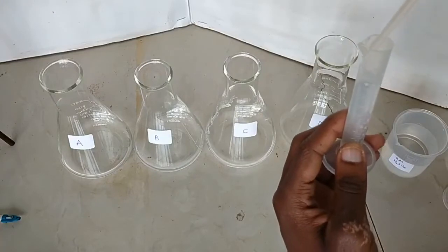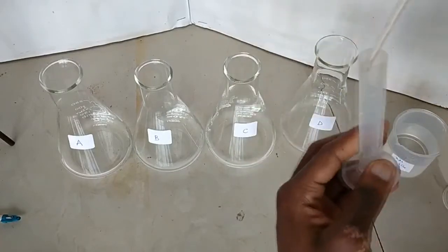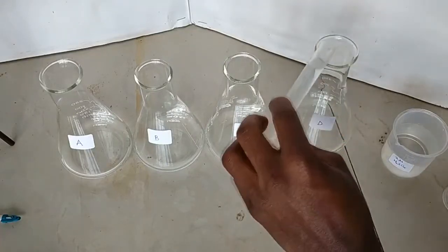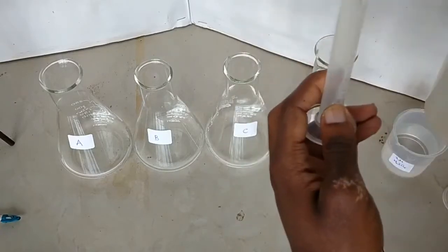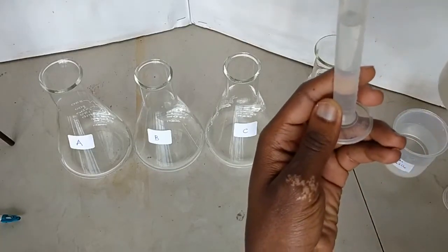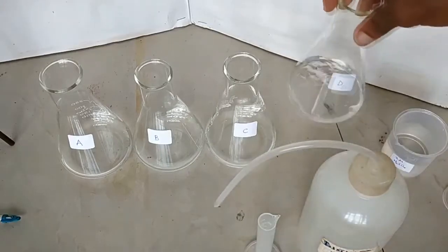For flask D, I had added 10 cubic centimeters of 2 molar sulfuric acid, and therefore I will add 30 centimeters cubed of distilled water — that's 10, I have two more. There we go — one more — to make it a total of 40 centimeters cubed. And I swirl the mixture.